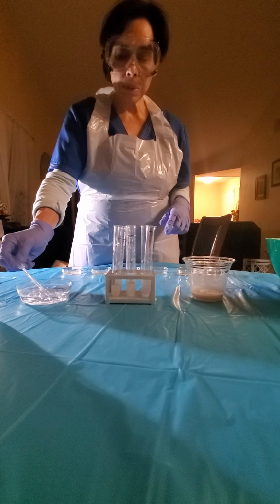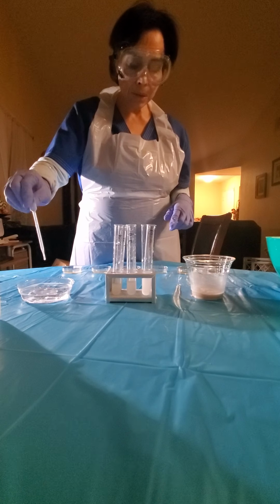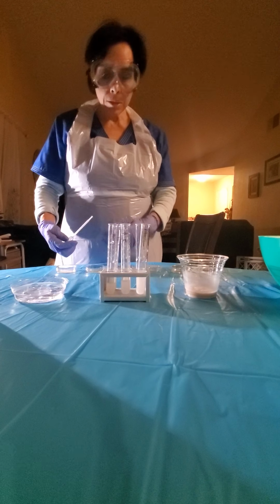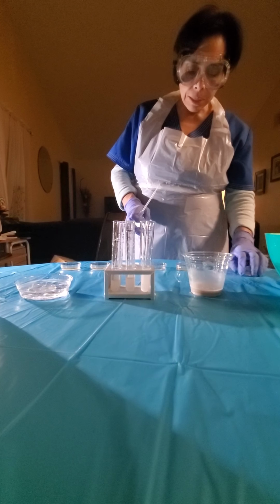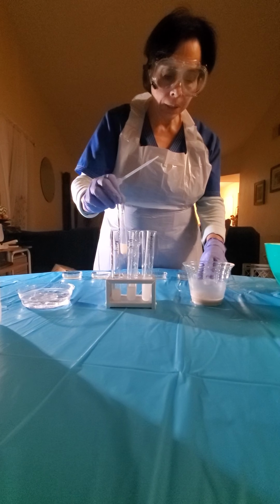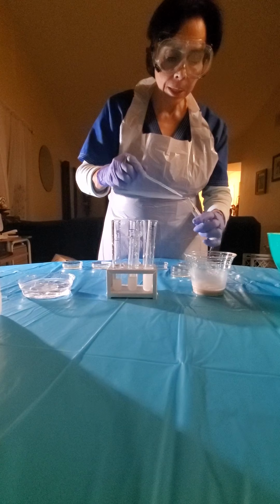So now our pipette has to be really clean, and the idea is to transfer to the plates. An individual plate will have the numbers, from the 10^-1 to the 10^-6. We want to just tilt a little bit to not contaminate.